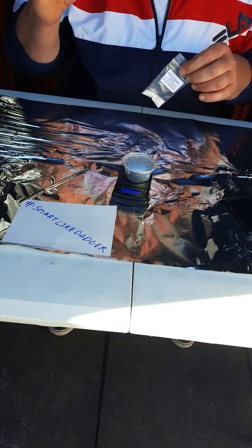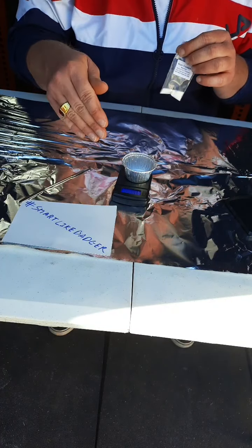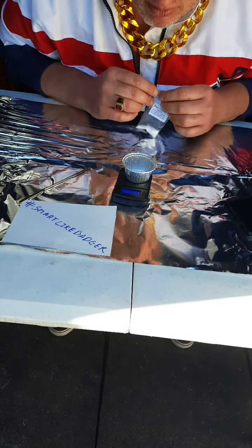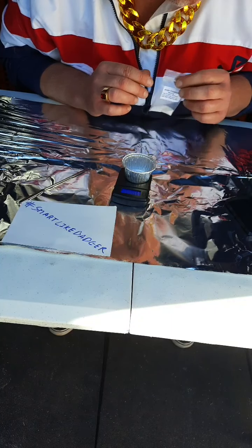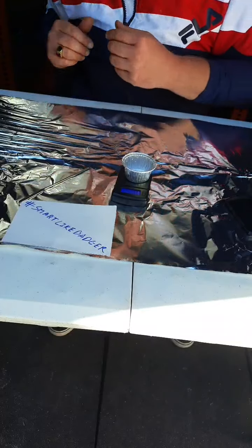The instructions say 2.0 grams, but it is more important you write down exactly what the number is. So, for example, my number is kind of wavering between 2.0 and 2.1. I say 2.0 for now, but if you happen to weigh out 1.9 grams, that's very good. You just write down what that number is. Boris take his own advice and write down this number.